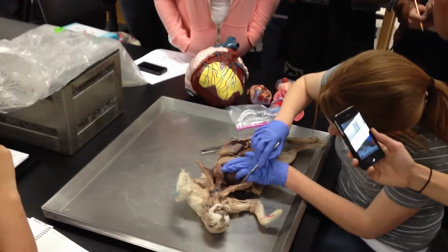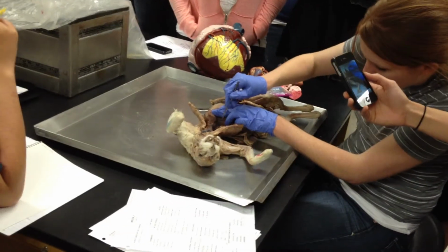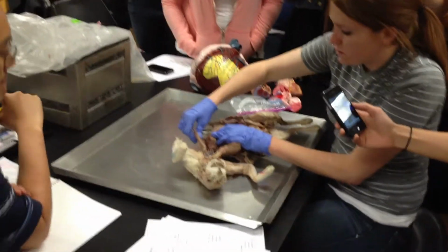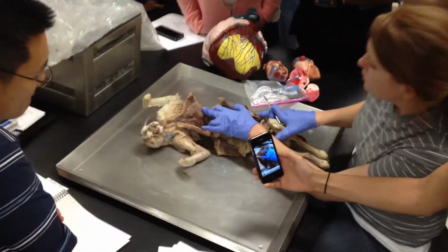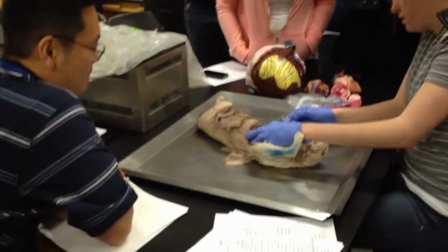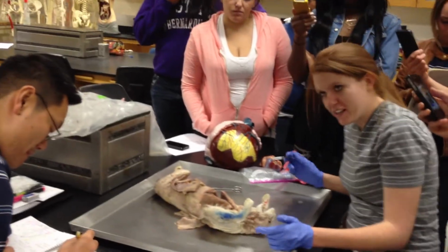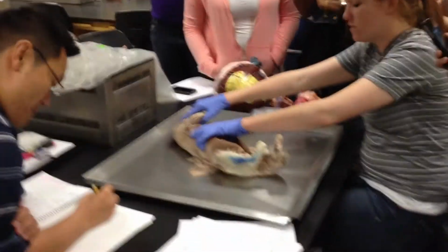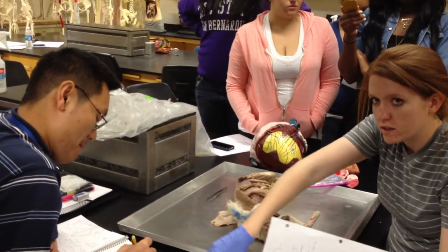The last and final vein coming into the superior vena cava before it enters the heart is the azygos vein. So I've got it out here. Here's the azygos, right there. The azygos right here. You said the last vein. It's the last tributary of the superior vena cava. Is it the superior or the inferior? The superior.